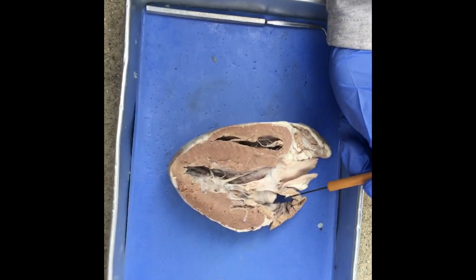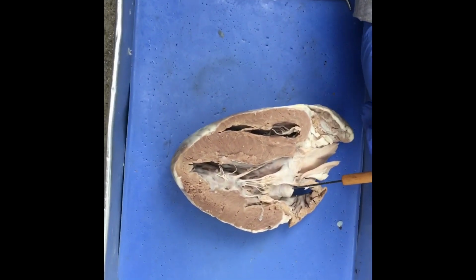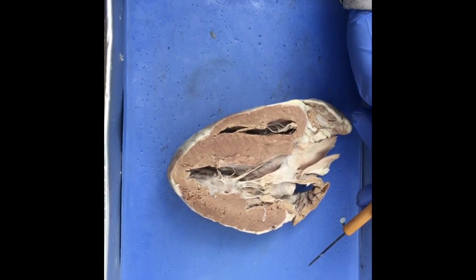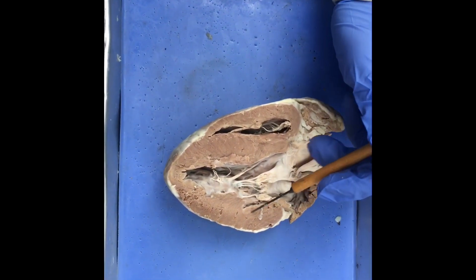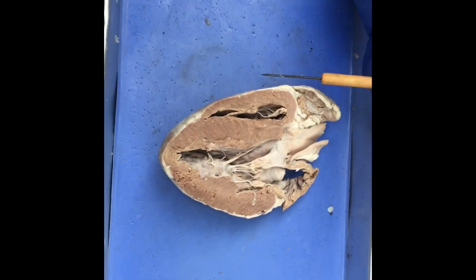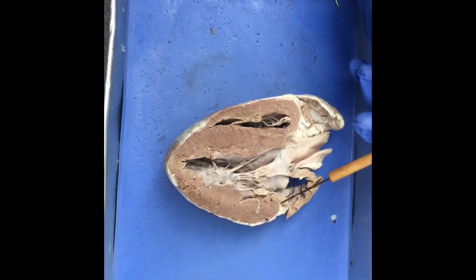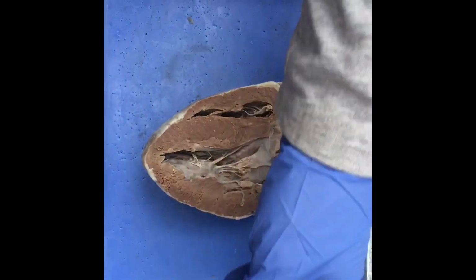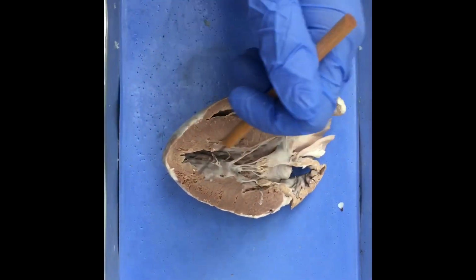So now let's talk about circulation, where the process has 2 parts. The deoxygenated blood starts off in the right atrium and then empties through the tricuspid valve into the right ventricle. From there, the right ventricle carries the blood over to the pulmonary valve, where the pulmonary valve takes it over to the imaginary lungs, I guess, that you can't really see.